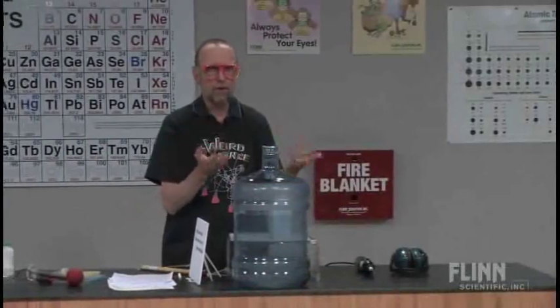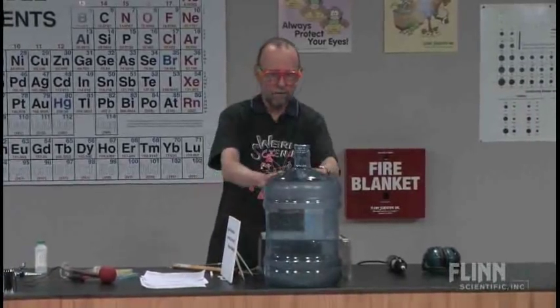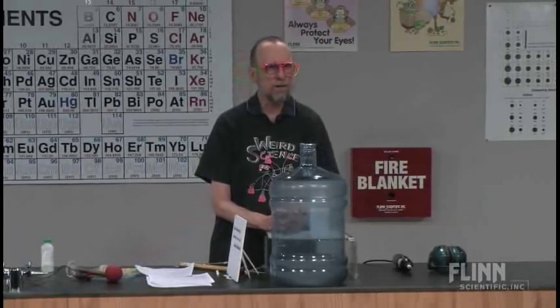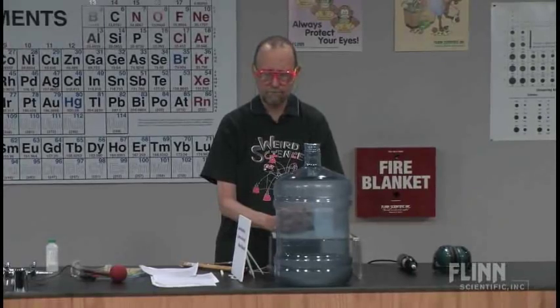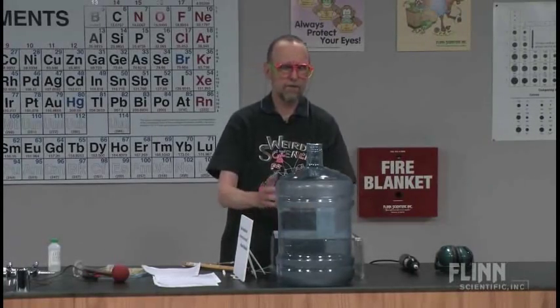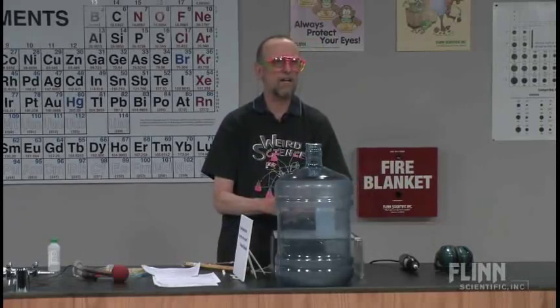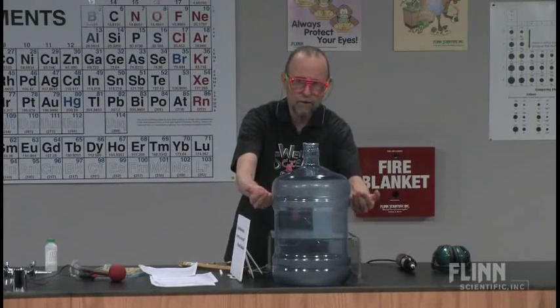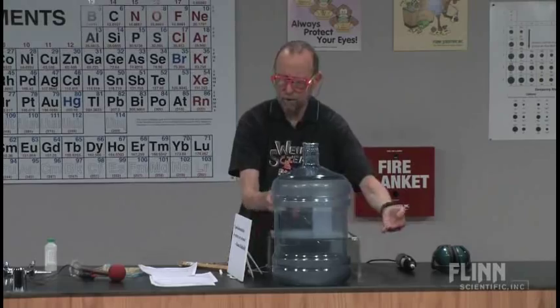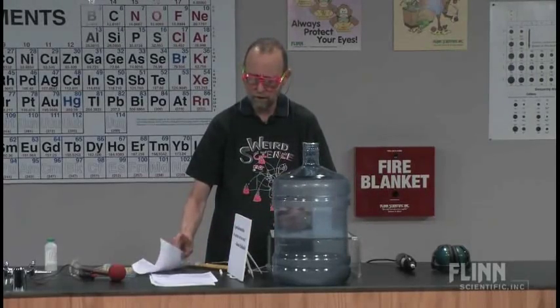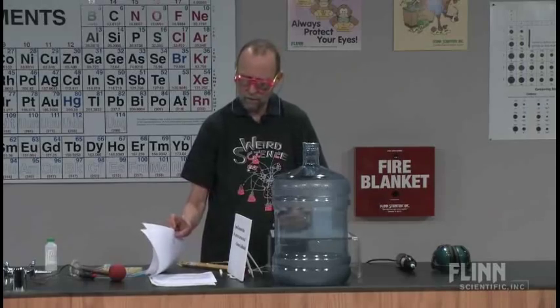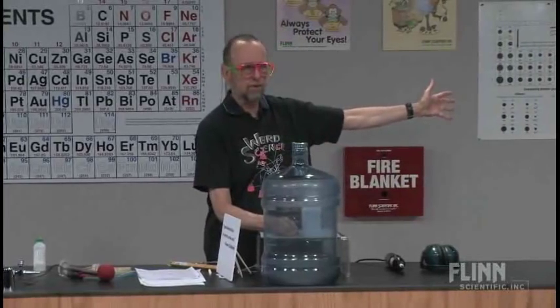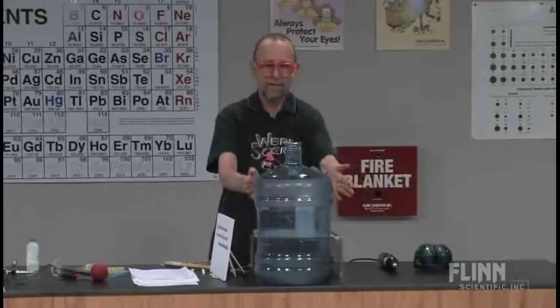So, and again, you can use this demonstration many times during the year. You can set it up this way. You can set it up this way. You can set it up any way you want. And it's really the vapors that are burning. It is not the liquid, per se. Okay. Bill Deese does this in a bottle like this, but he uses isopropyl. I believe it's 70% isopropyl alcohol. And sometimes you can get a nice flame to just creep down the side, and it's not a big boom. So, if boom's scary, you might want to try it with isopropyl alcohol. Okay. Let me see for my notes if there's anything else. No, there's not. So, to sum it up, this is a wonderful reaction. You can do a million things with it and use it over and over during the year, and that's not bad at all. And it's easy to set up.